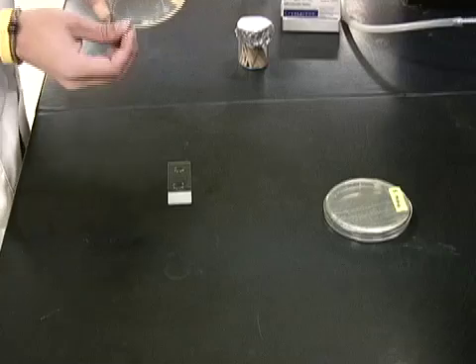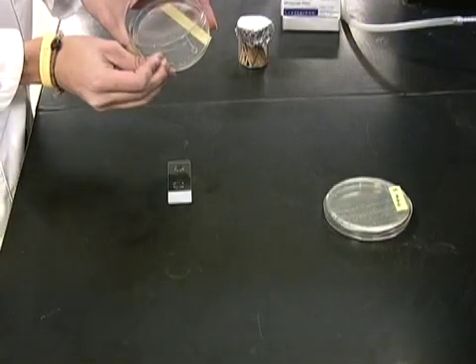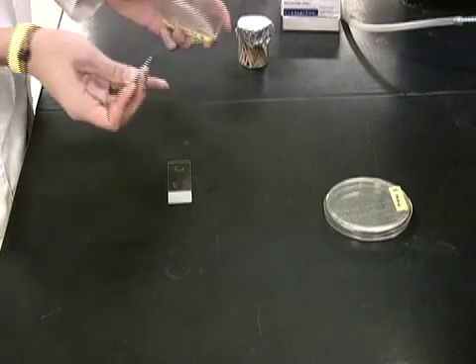Using a sterile wooden stick, pick up a colony of Staphylococcus epidermidis and swirl it in the drop.